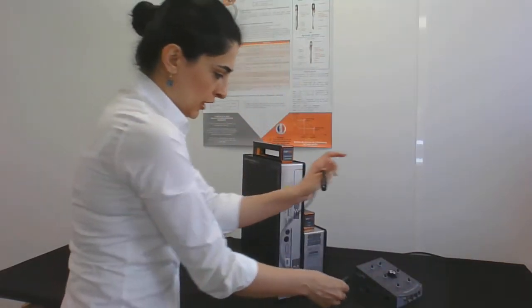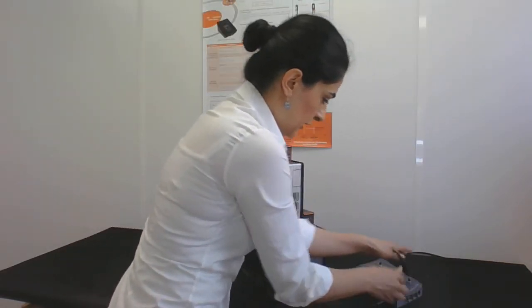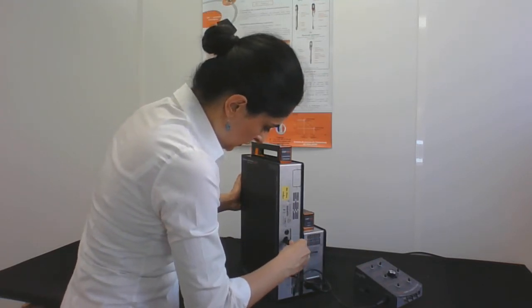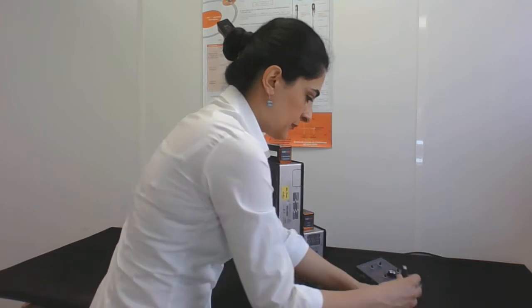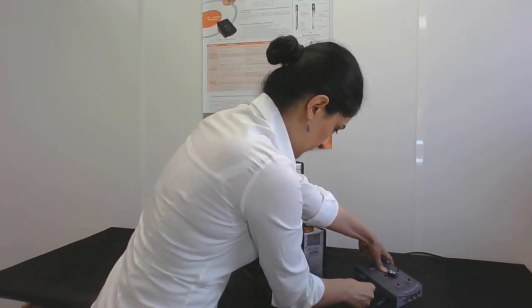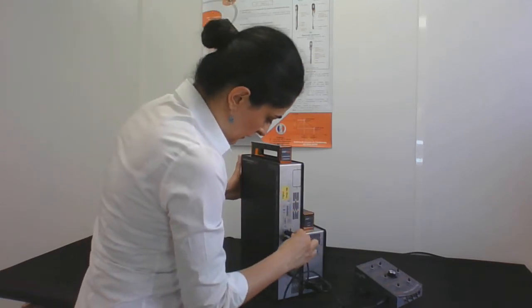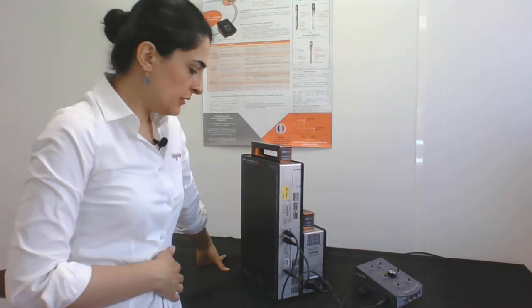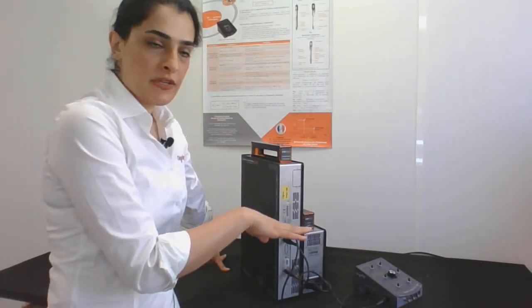Now, you need to connect the circuits by the cable to the instruments. So, I connected the related circuits by these cables very easily. Now, the connection is finished.